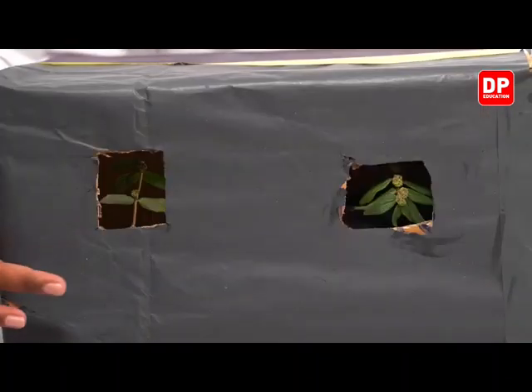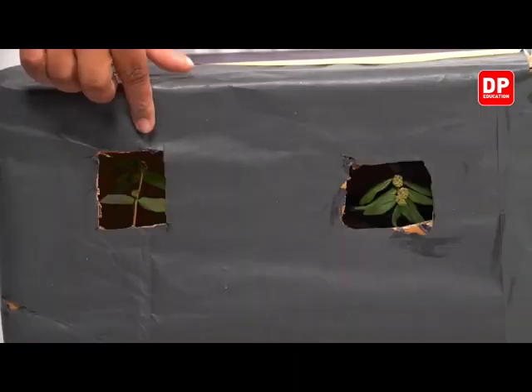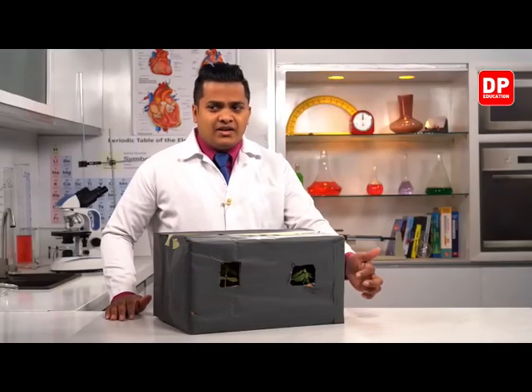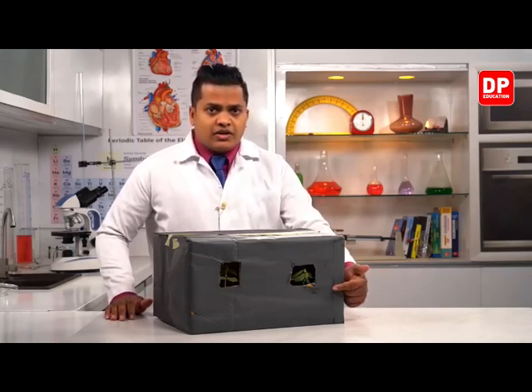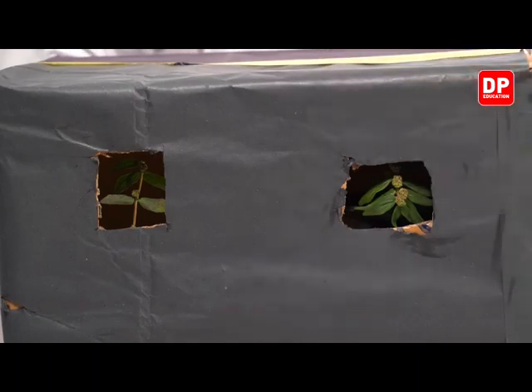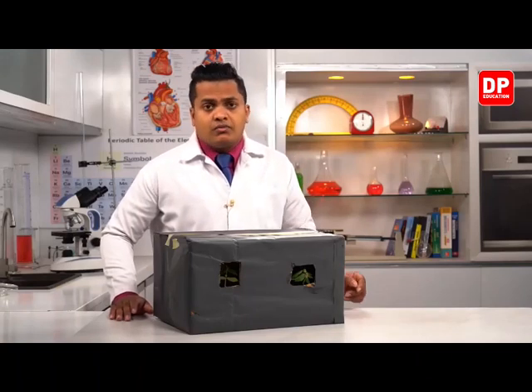However, the one which is over here, there's no such development, there's no such growth. It's because in this one, my dear children, I have removed the apex. So you can clearly see that it's not growing significantly like in the previous one over here, right? Here the apex is growing, my dear children. Here you can see it very clearly. The apex is growing towards the area or towards the light from the removed part of the box.